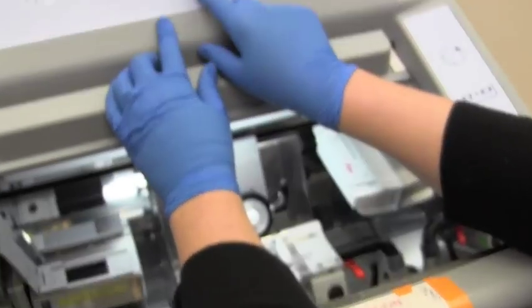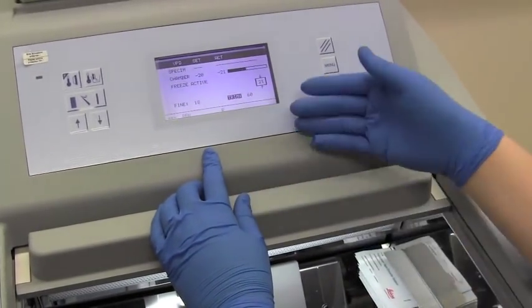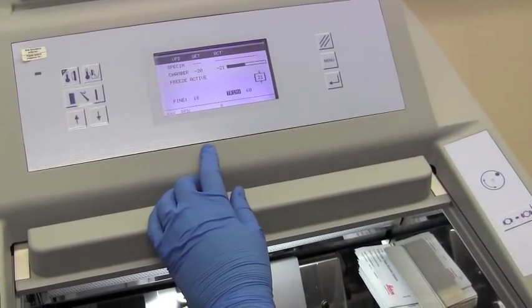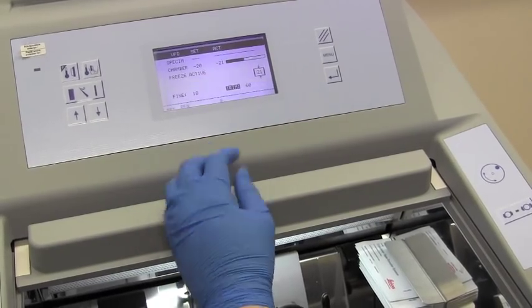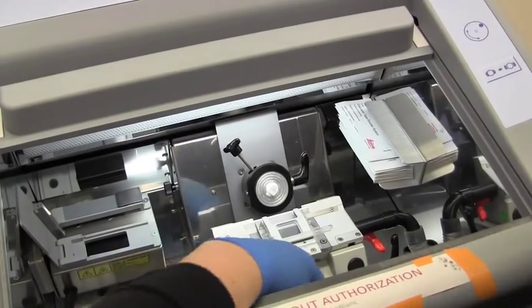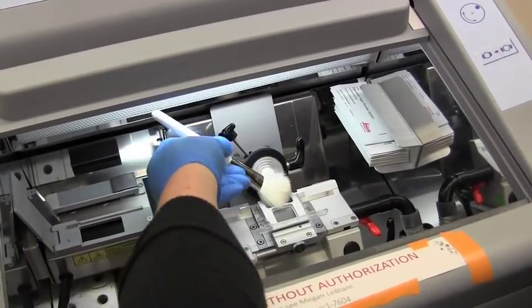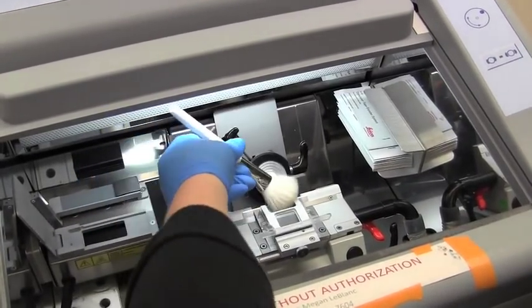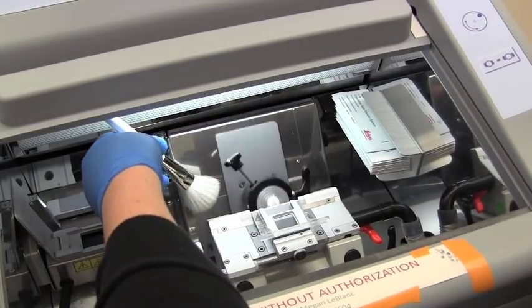So here I have it set to trim. And this way I'm advancing 60 microns with each turn of this wheel. And this will allow us to get to our sample faster. It helps to have your brush handy to remove any of the excess matrix that's being cut off.